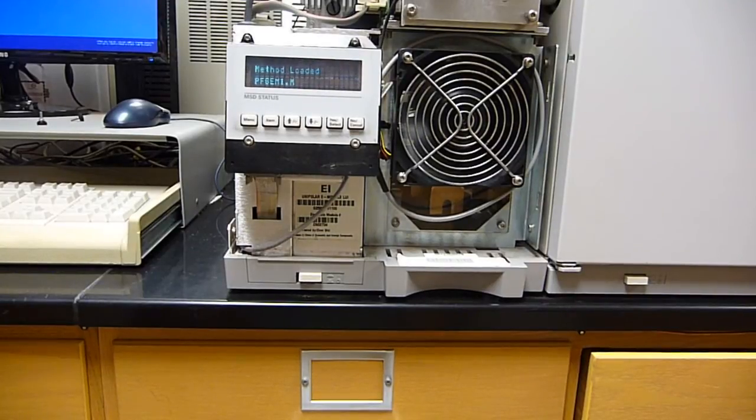There are about a dozen other service tricks that we use to keep this system going for as long as it has been. And they'll be cataloged more comprehensively in another YouTube video.